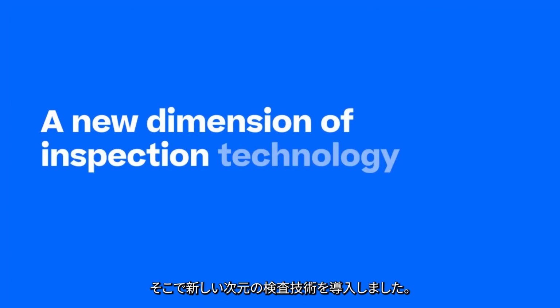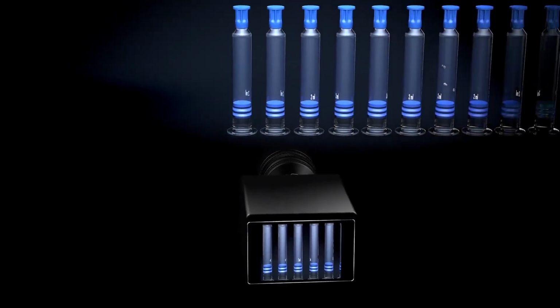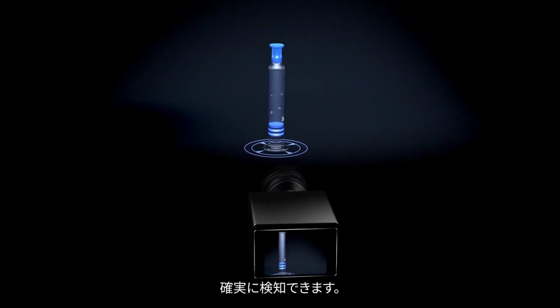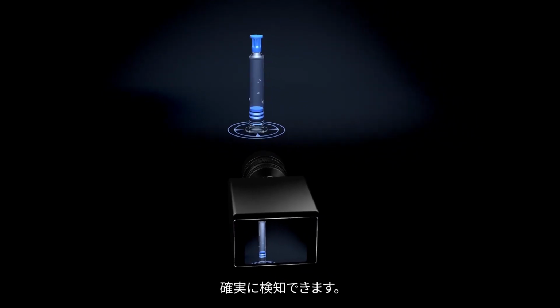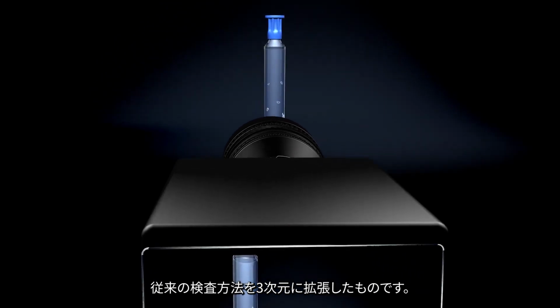Introducing a new dimension of inspection technology: 3D inspection of highly viscous products. This revolutionary 3D inspection by Seidenader solutions enables the reliable detection of particles in highly viscous products such as hyaluronic acid. The conventional inspection method is extended by a third dimension.